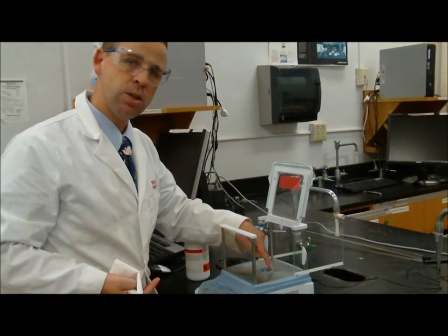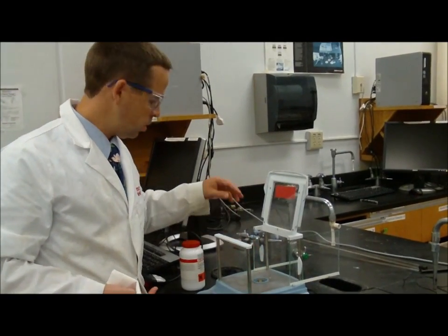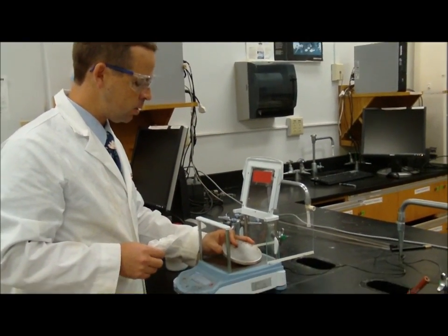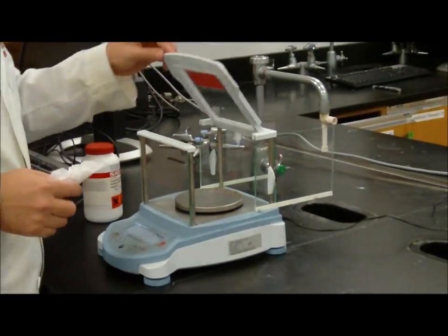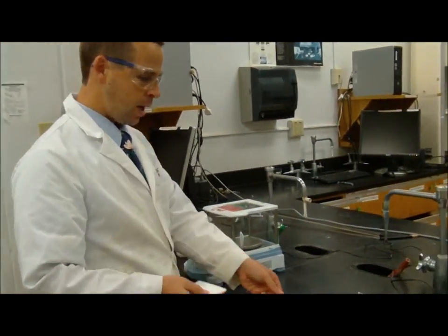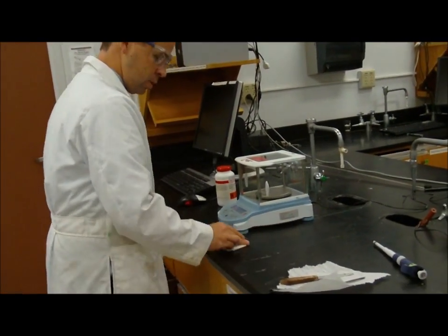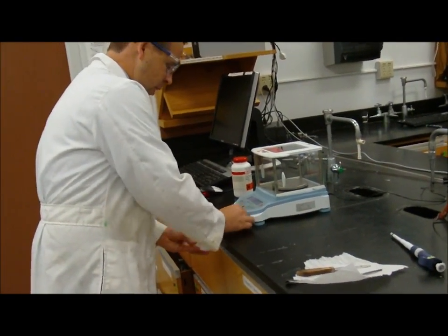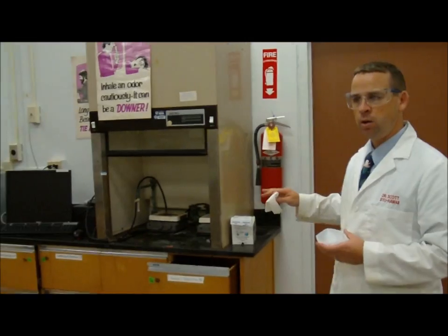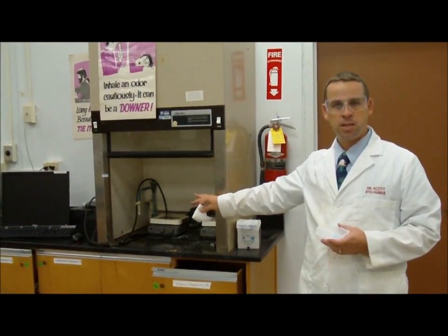I want to be sure that when I'm cleaning, I'm not putting any dust into this area, and that I don't touch this area or anything, even with the paper towel. When it's all swept out, I put this on gently, and then I close the doors to keep it protected. Any extra that I have, I'm going to sweep into some sort of a container, or if I don't know where it goes, I can ask the professor, or I can ask the TA if it's okay to throw this in the garbage. If it's not, then I'm going to put it in some sort of waste container, which is generally kept here in this hood.